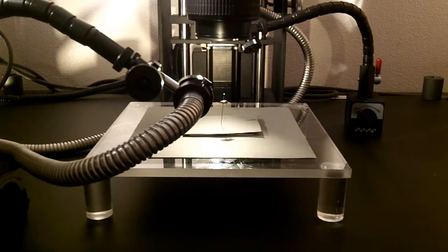So here I have the specimen in live view, the top of the back more in focus than the rest of the parts of the body. This is what the fiber optics will look like. Here is what it looks like with the fiber optics and the studio lights on. And this is just the studio lights.